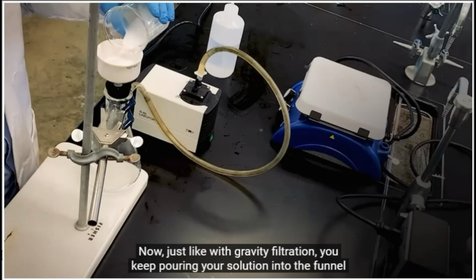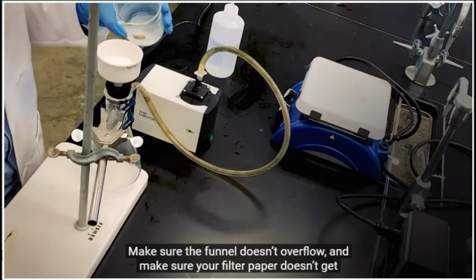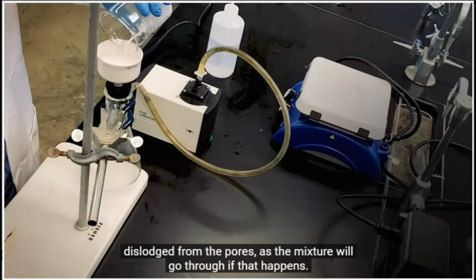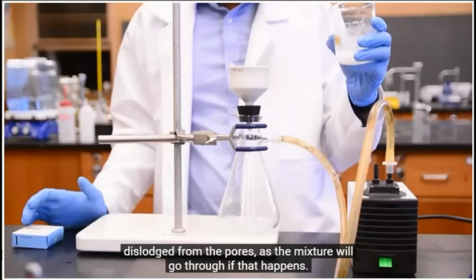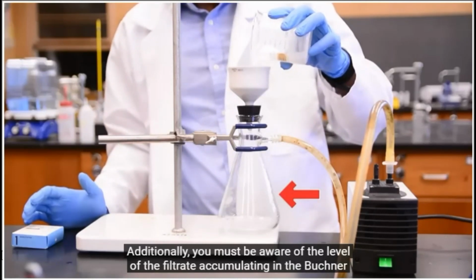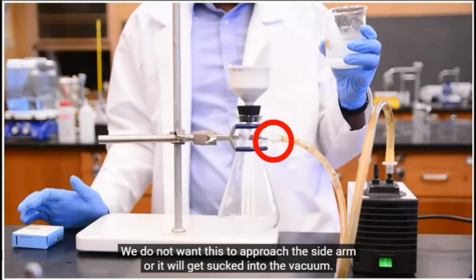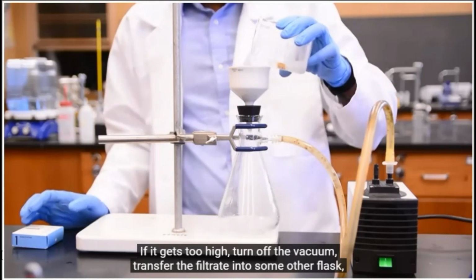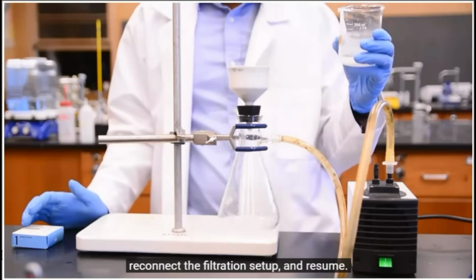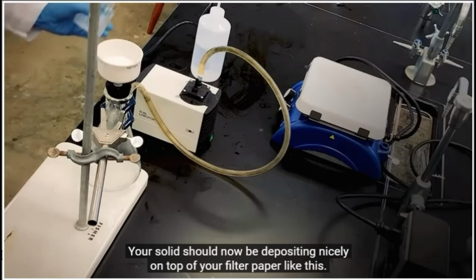Now, just like with gravity filtration, you keep pouring your solution into the funnel until you're done. Make sure the funnel doesn't overflow, and make sure your filter paper doesn't get dislodged from the pores, as the mixture will go through if that happens. Additionally, you must be aware of the level of the filtrate accumulating in the Buchner flask. We do not want this to approach the side arm, or it will get sucked into the vacuum. If it gets too high, turn off the vacuum, transfer the filtrate into some other flask, reconnect the filtration setup, and resume. Your solid should now be depositing nicely on top of your filter paper like this.